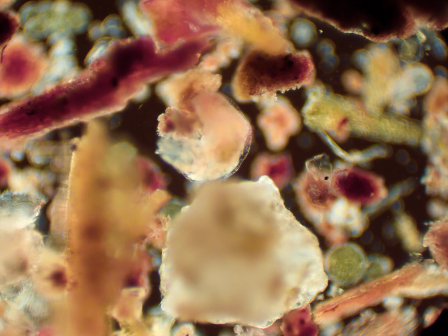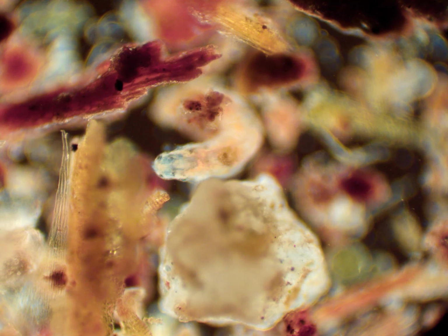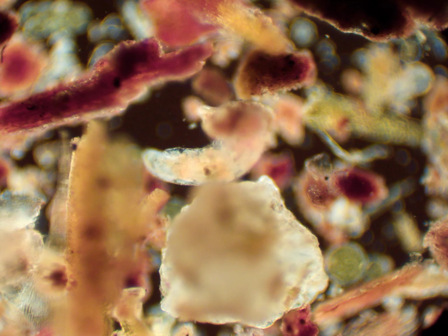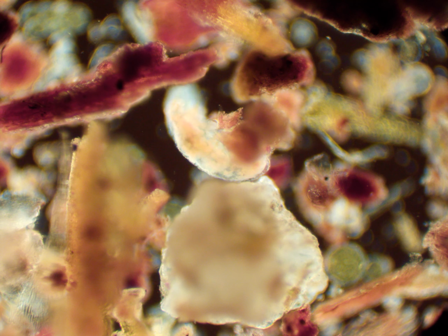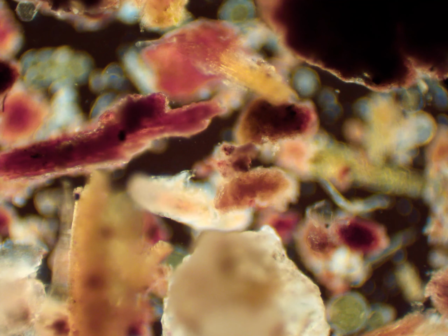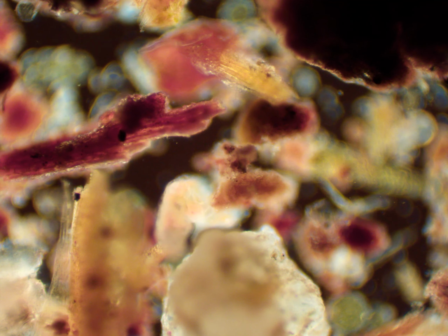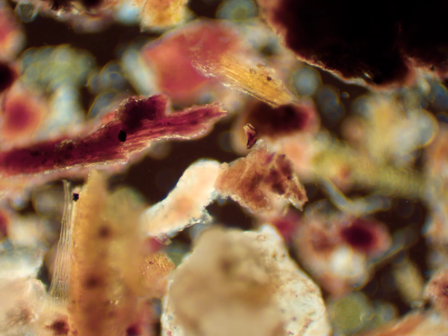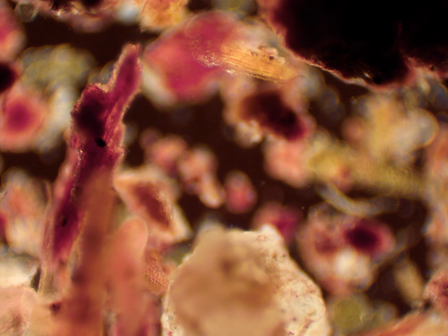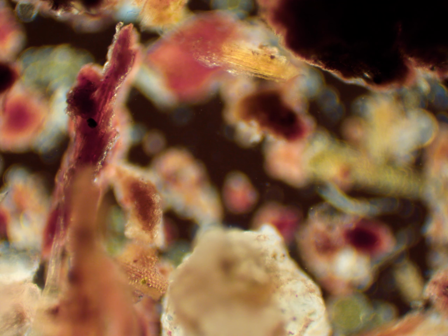You can see it crawling around here with its 8 small legs, and you can see its 2 eye cells. They are single-celled eyes. The eyes are only made up of one cell, unlike most eyes on organisms from the kingdom Animalia, which have eyes made up of several eukaryotic cells, though the tardigrade has eyes of only one photoreceptive eukaryotic cell.